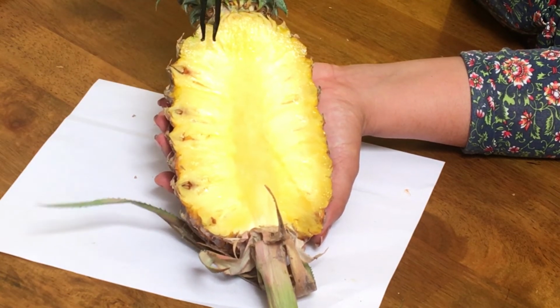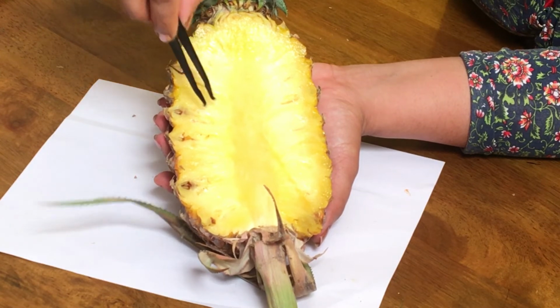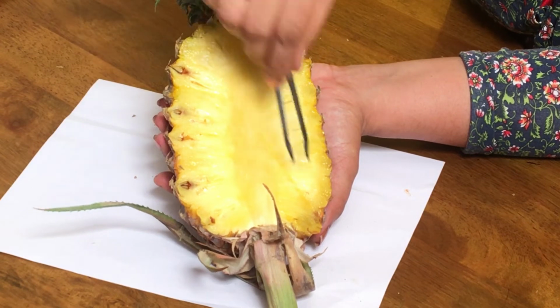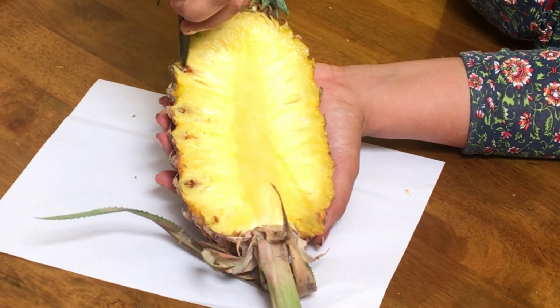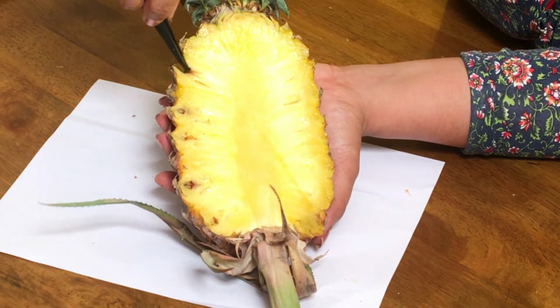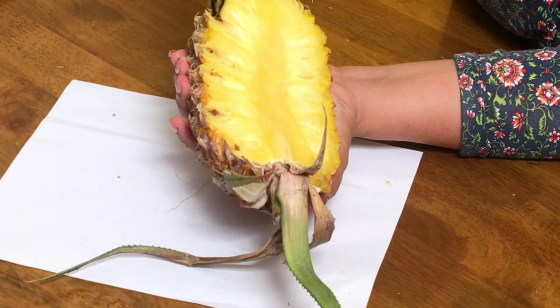These are the sepals, the bract and thin ovary wall. All these things became fleshy, juicy and sweet in taste, and they combine together like this and give the appearance of a fruit. Now what are these parts? This is actually the nectar gland of pineapple, which produces nectar. So this is a nectar gland, and here at this part you will be able to see the stamens.